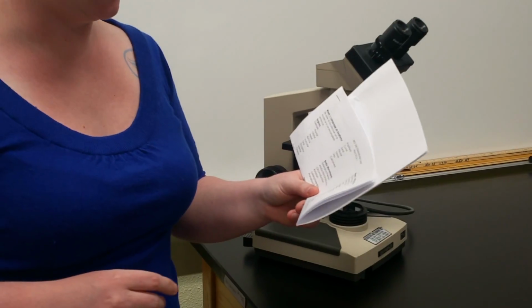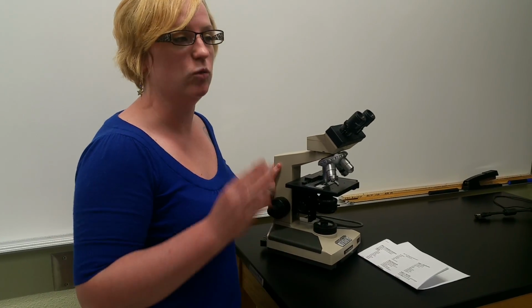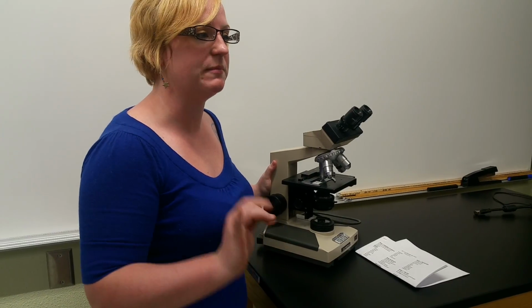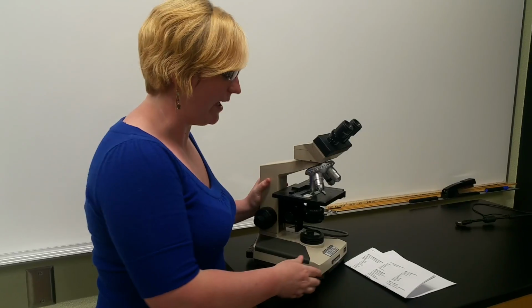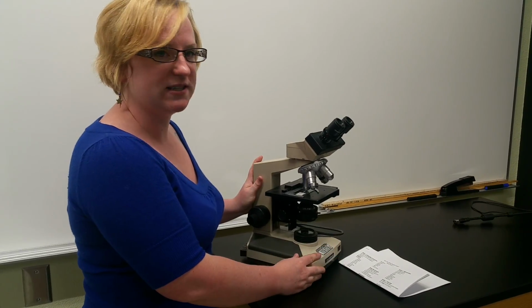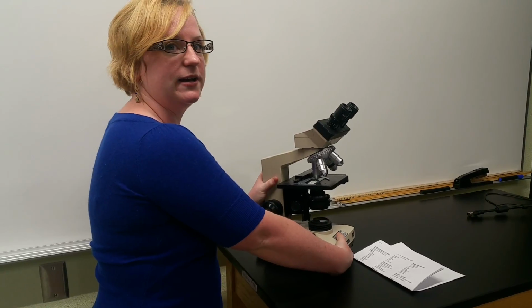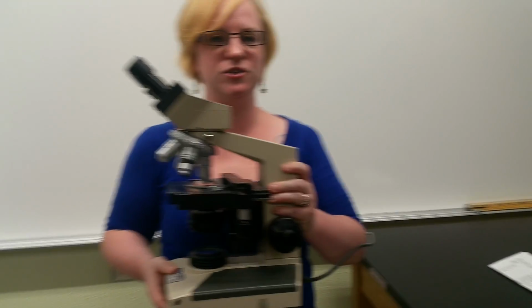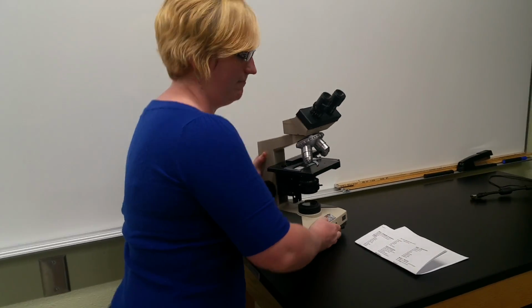So at the top of the list here, one thing I want to mention before I go down the list is when you're carrying, if you want to carry a microscope around the room, because there will be microscopes provided to each table for you guys to look at, always make sure you have 2 points of contact along the bottom here, which you'll learn the name of in a moment, and along the back here. So if you're ever going to carry it around, 2 points of contact always at the most stable parts of the microscope. Just want to mention that.